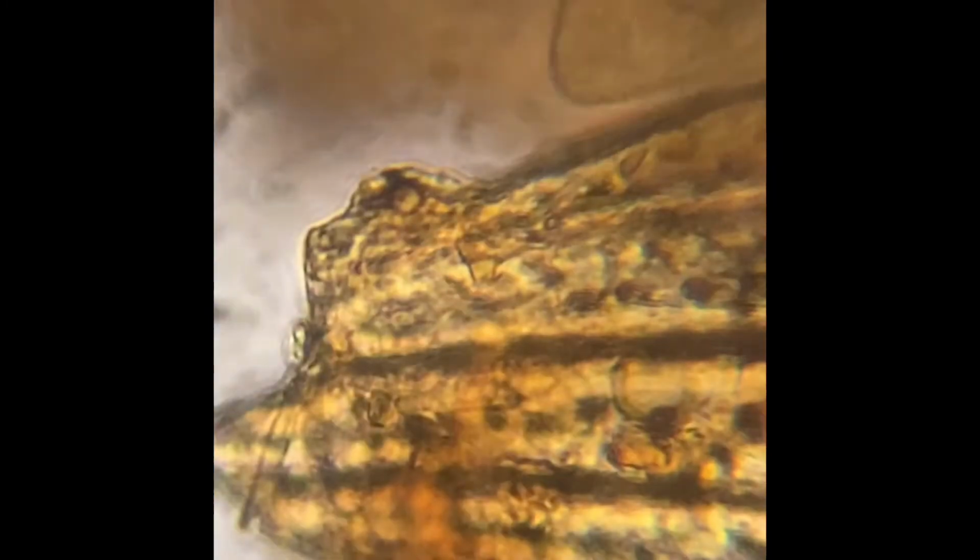It's cool. I think it's one cell. Why is it moving? Probably to look for food. What's that thing? Or a mate. What is that? Those are like a bunch of plant cells. No, like what's that brown thing? That's what I mean, like dead plant something. Oh my god, that's so cool. Is that from snow? No. This is from plant water.